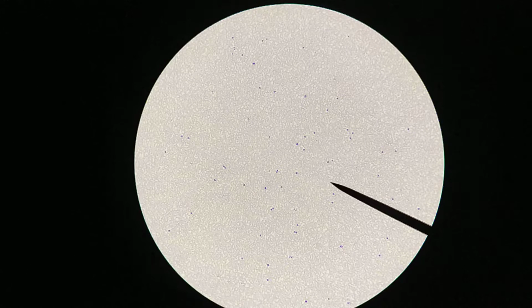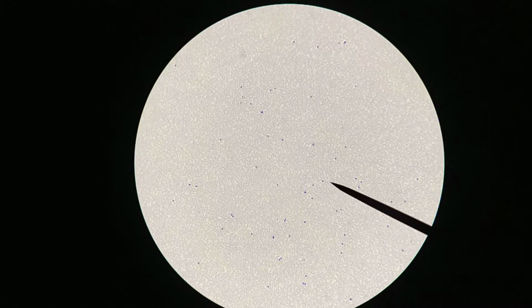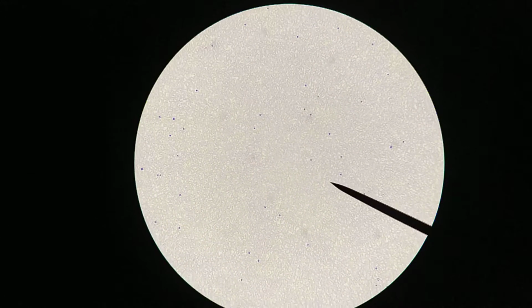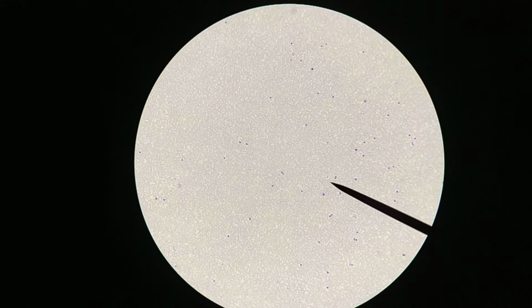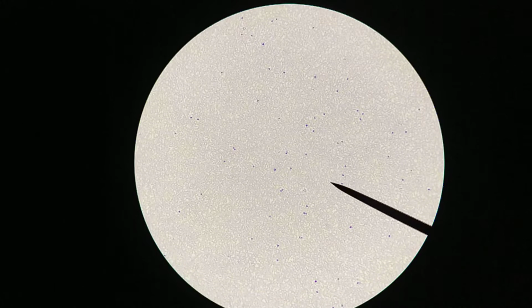Hi everyone. In this slide we're looking at a human blood smear. Now this region here I've actually selected because it has a lot of leukocytes in it. You could scan to other parts and you probably wouldn't find quite as many. In this case we just have a nice region with lots and lots of leukocytes to try to focus on. So we're going to focus in this region.